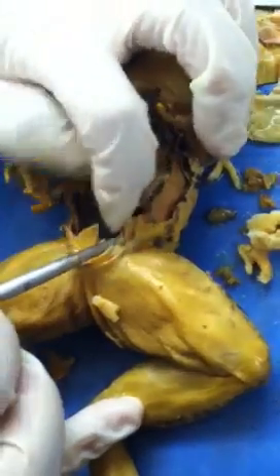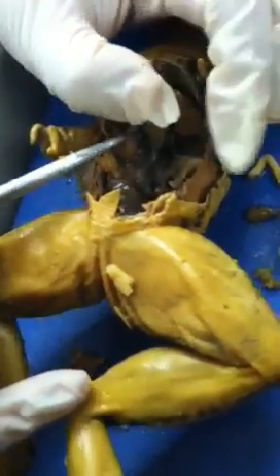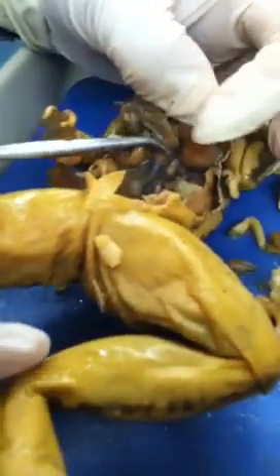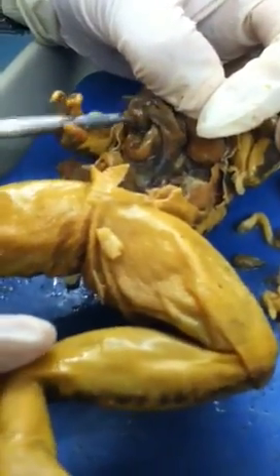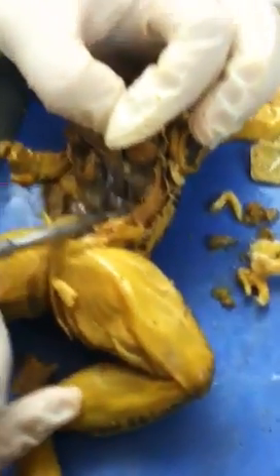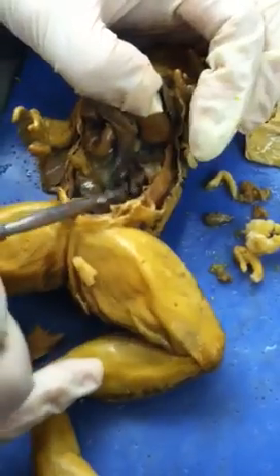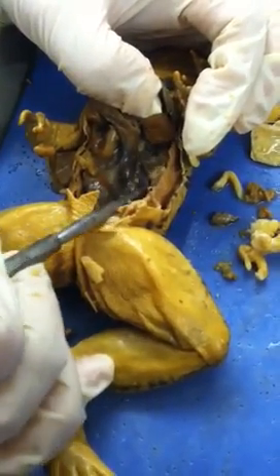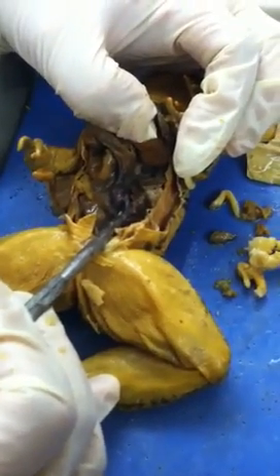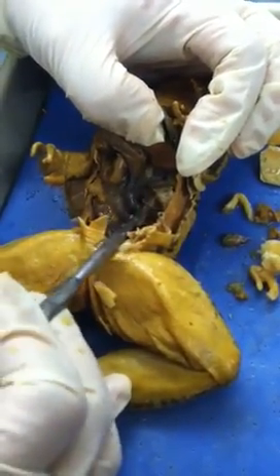If you flip the stomach, you get a better view of the pancreas right here — it's a kind of whitish, ligament-like structure. Then you will see a bulb that's very dark red — that's the spleen. The reason it's dark red is because its function is to produce red blood cells, and it also stores red blood cells.